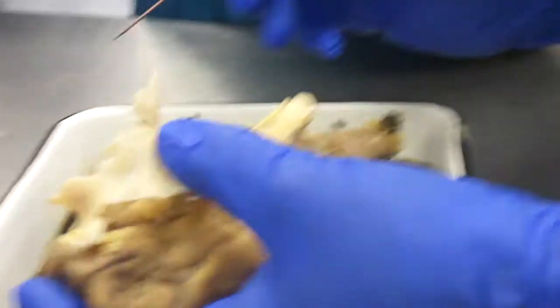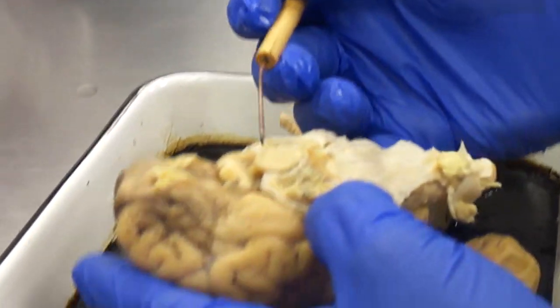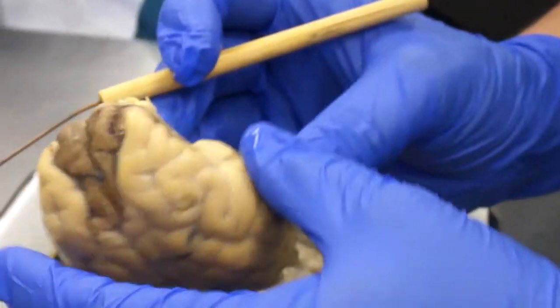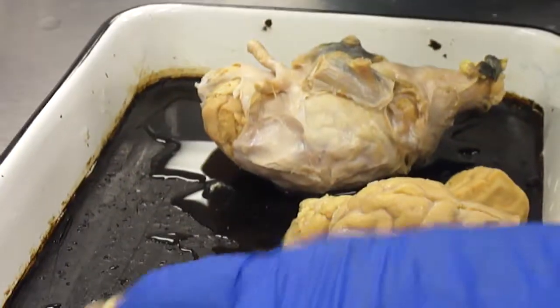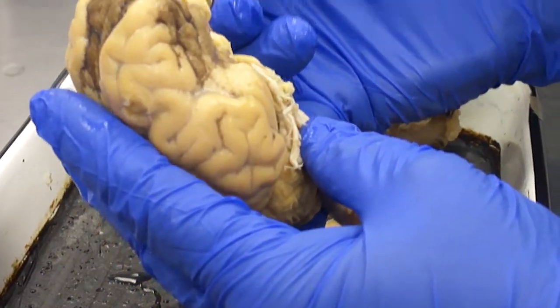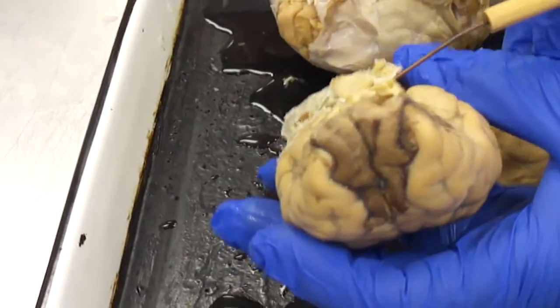And the hypophysis, the pituitary gland, is just behind the optic chiasma. Okay? This is big. This is being protected. I don't want to take it off. So anyways, it sits, name this structure. You can see the hypothalamus. Here's the pituitary gland. Looks too big. I think that's just part of the tissue.